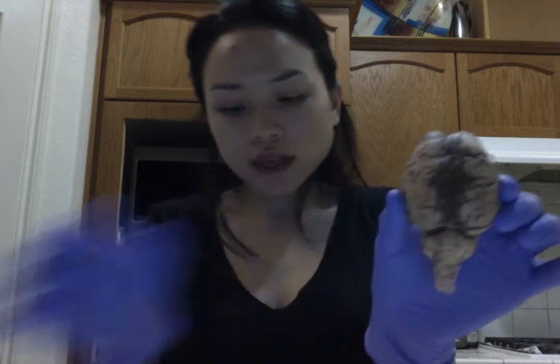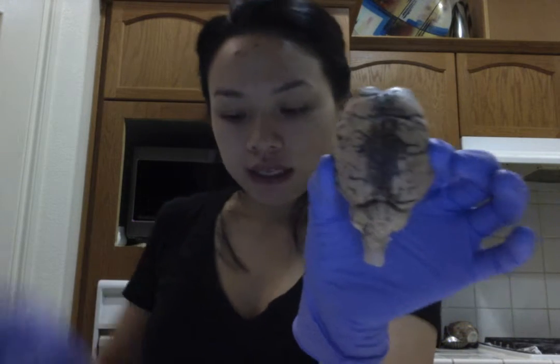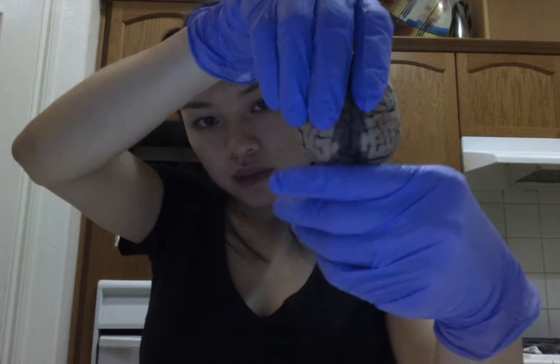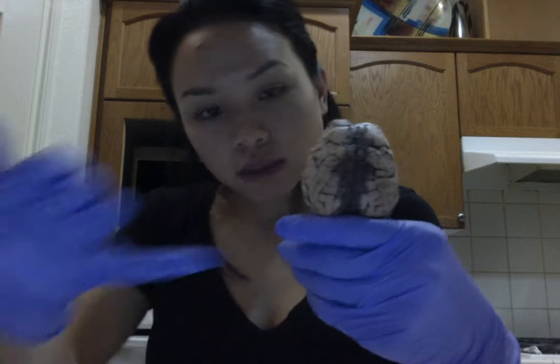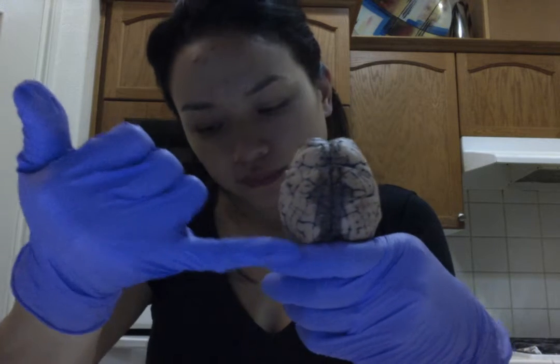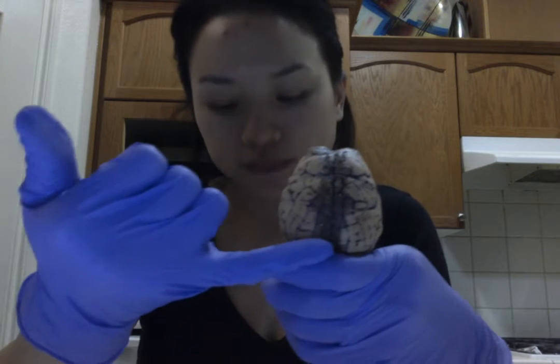I will first conduct a gross anatomical examination of the sheep brain from the dorsal perspective. Located within the cerebrum, so just the cerebrum of the sheep brain, we have the four different lobes. The first lobe that I'll be talking about is the occipital lobe, which is posterior of the brain, and it receives and interprets visual sensory messages.